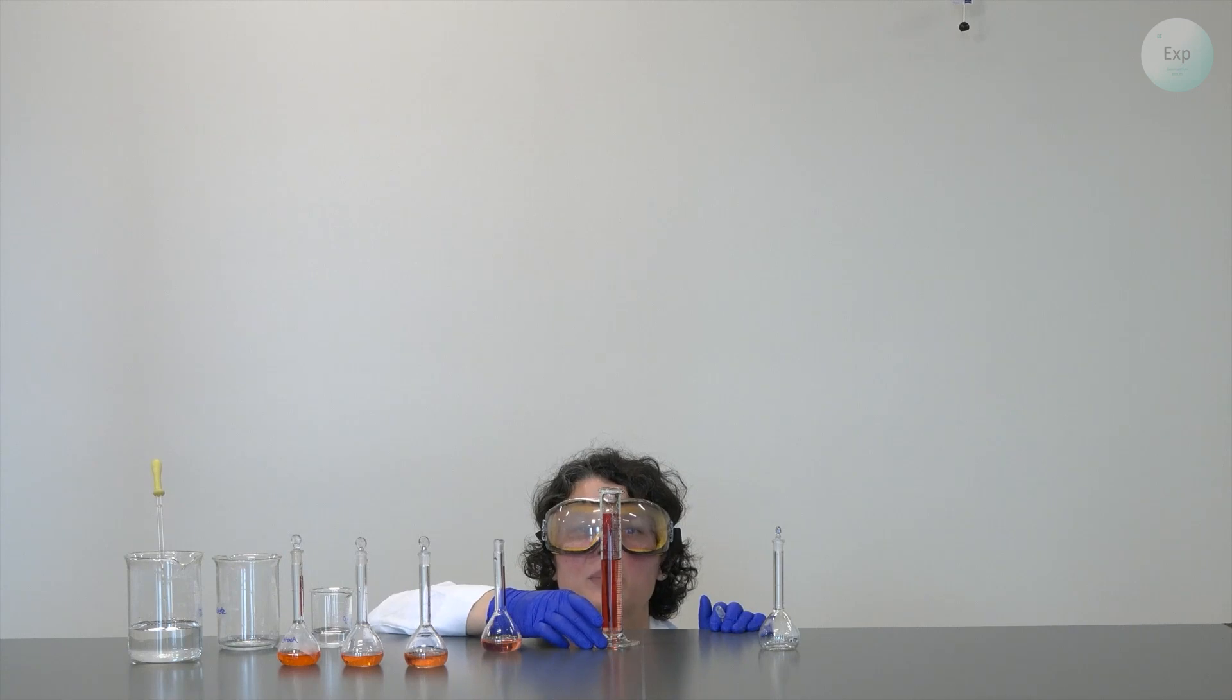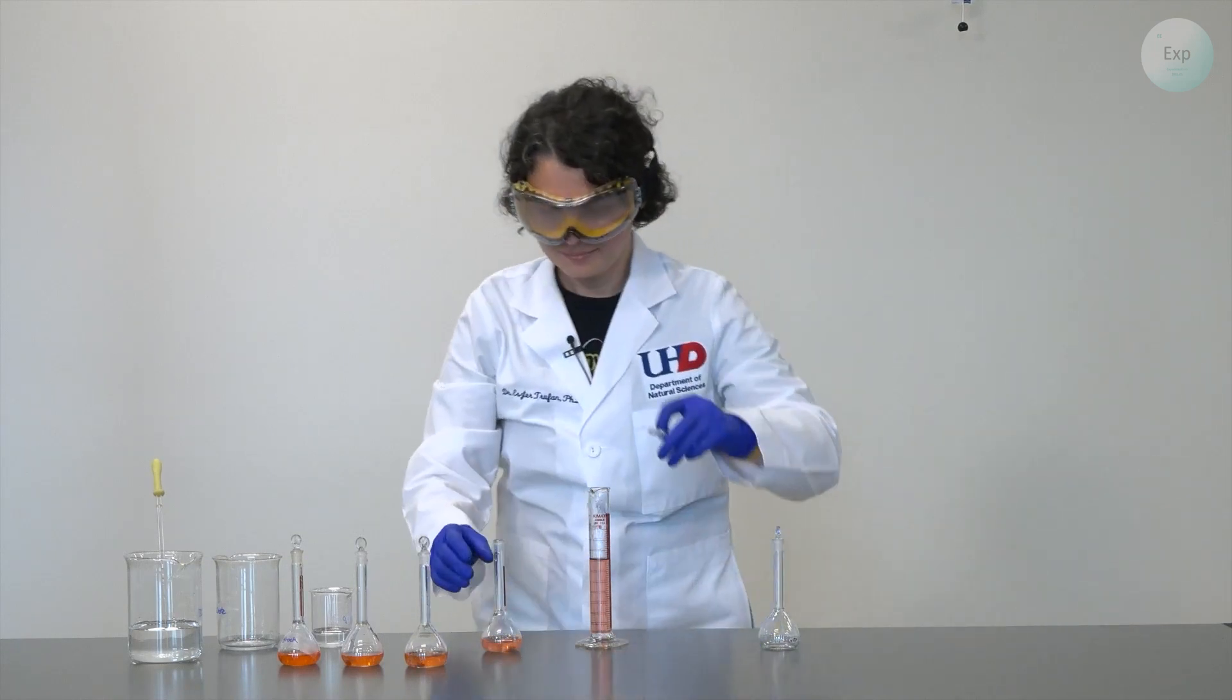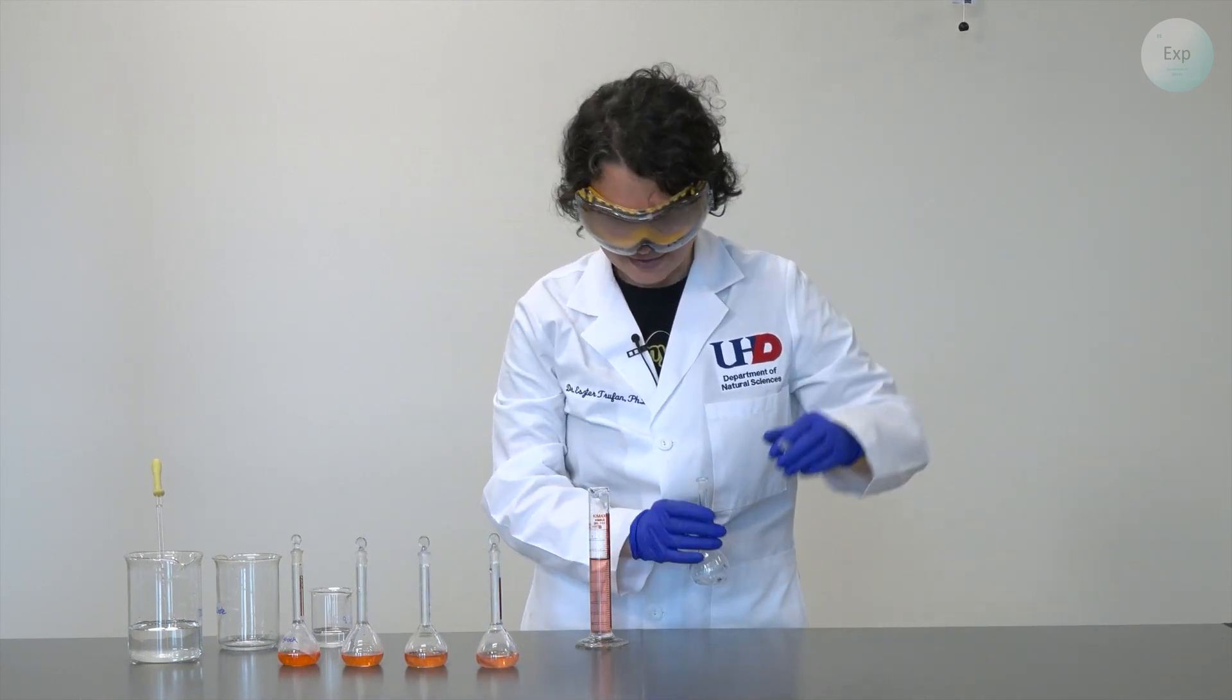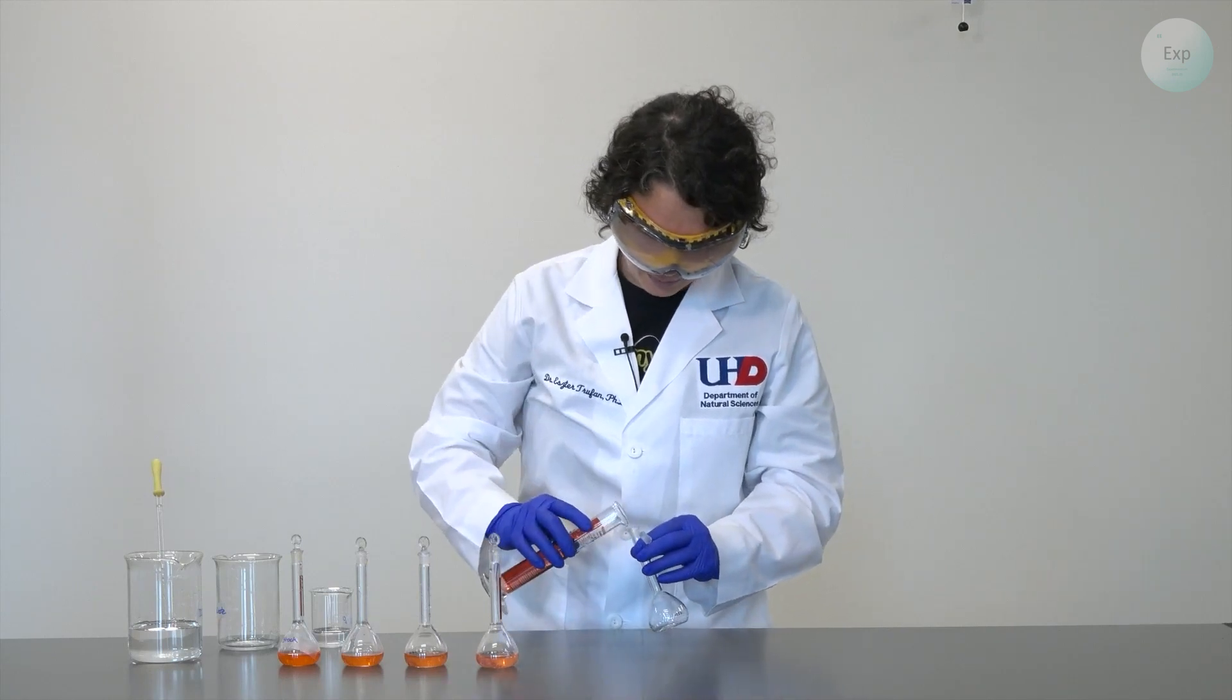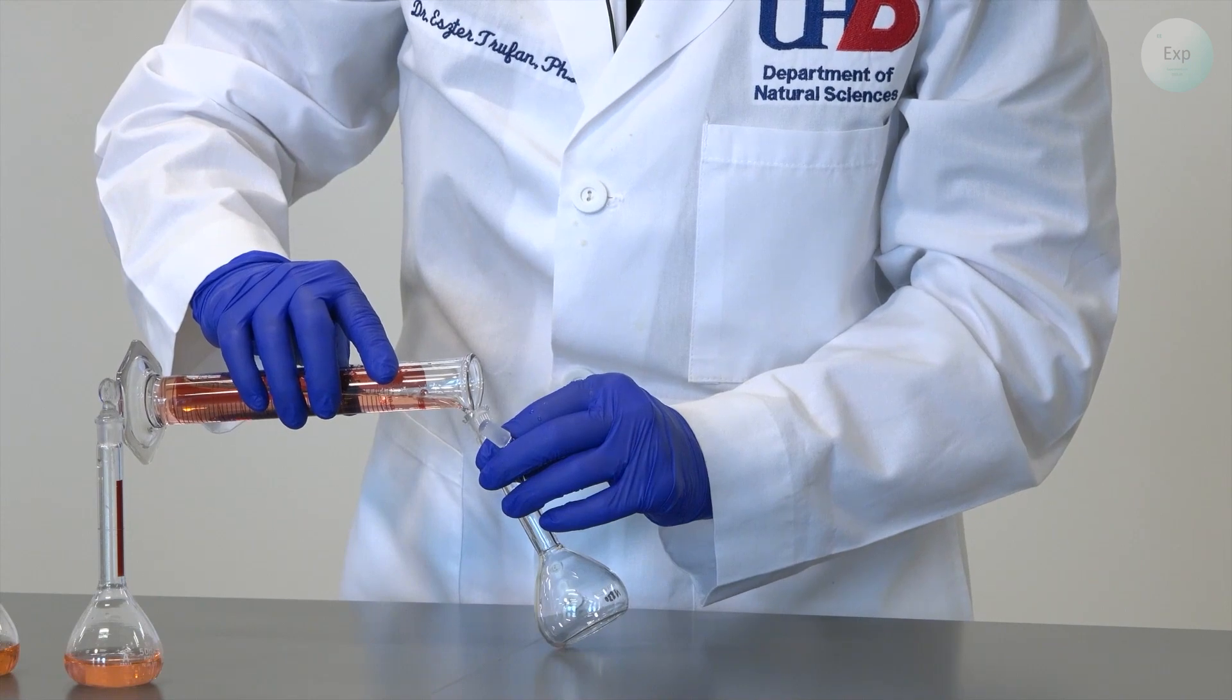I measure down to just a little bit more than necessary at 35.2 milliliters. With this, I will place the cap on my second to last solution and pour the final amount of solute in my last volumetric flask.